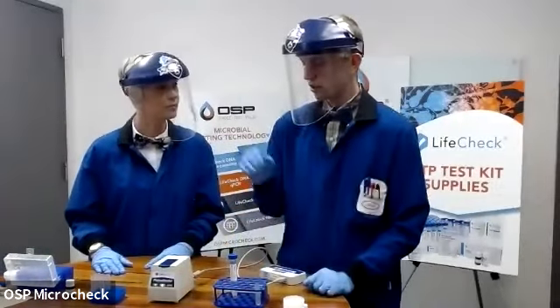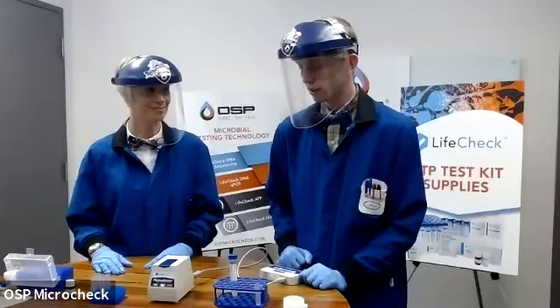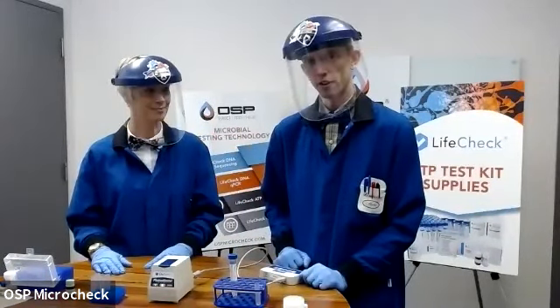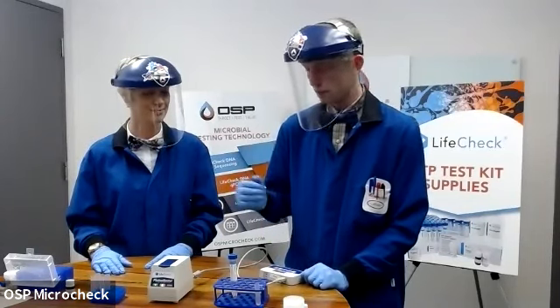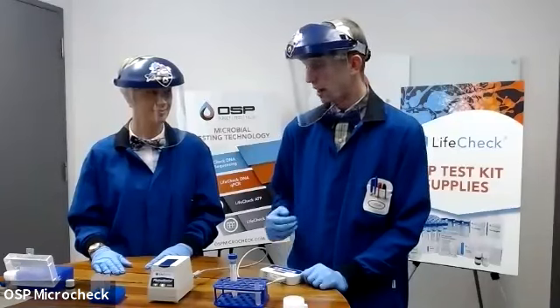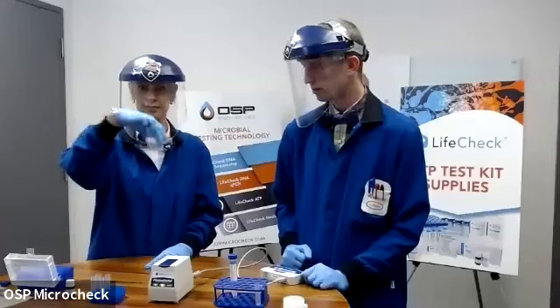All right, so we've done our 2 controls. We've got our blank that tells us that our instrument is ready to go and doesn't have a high level of background noise. We've done our positive control that tells us our enzyme is healthy and ready for testing. Now we're ready to go ahead and figure out the amount of ATP we actually have in our unknown sample.